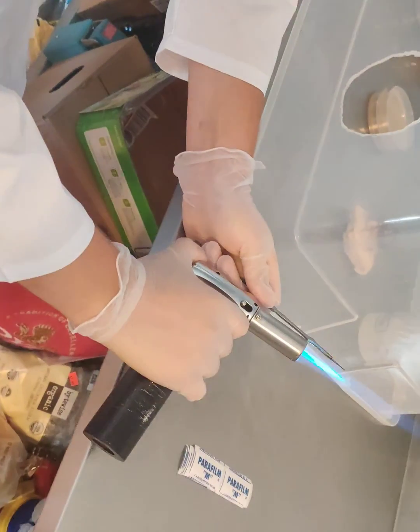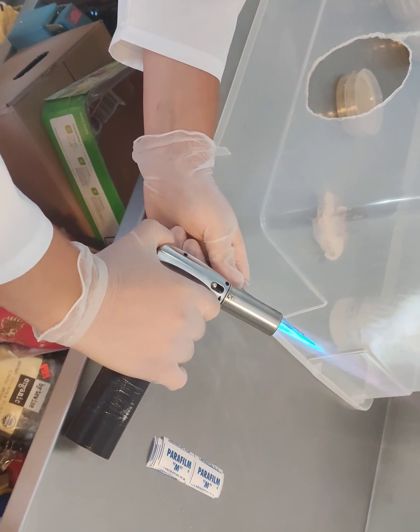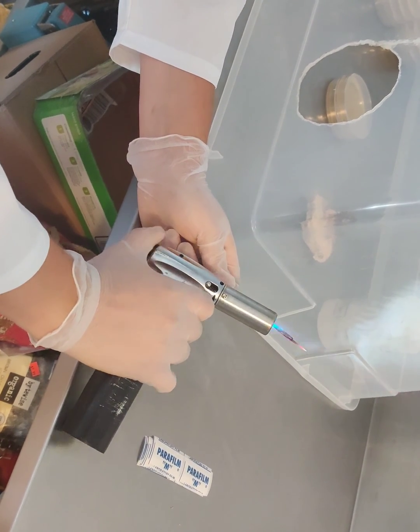The first step is to flame sterilize your scalpel. Be sure to do this outside of the still air box so that you don't ignite any isopropyl alcohol.